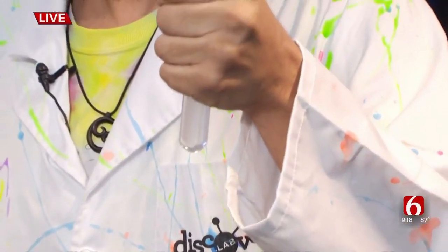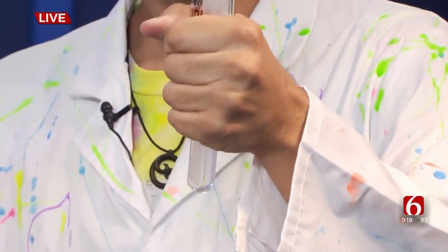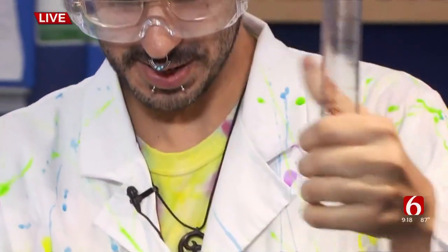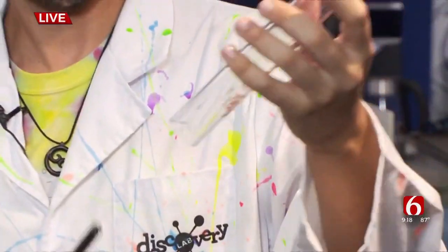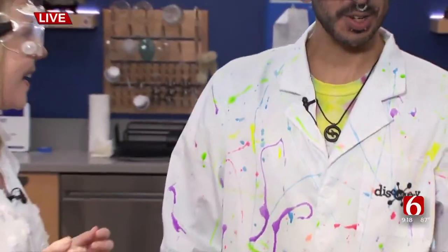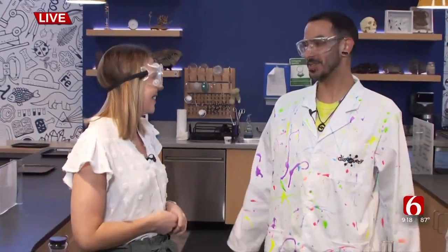You're just showing that science can be fun, right? All right, let's get one more swirl and get a nice big bark on this one. I just love that so much. It's quick, but it's fun — it gets people's attention and it's fun.